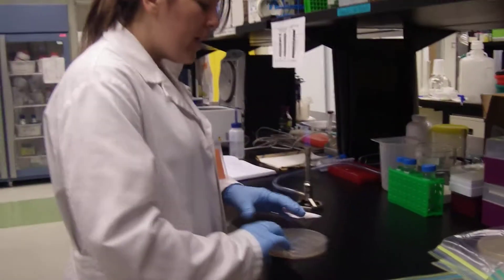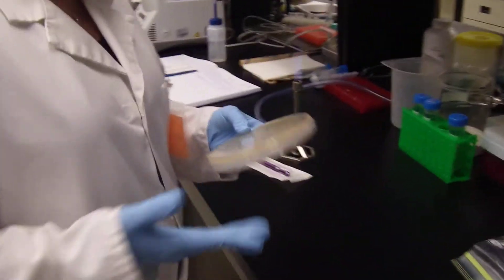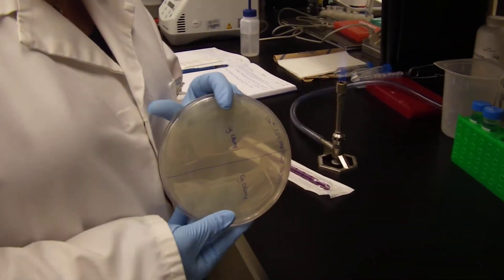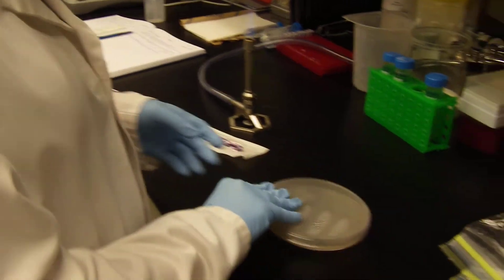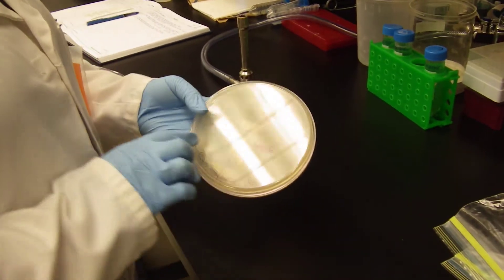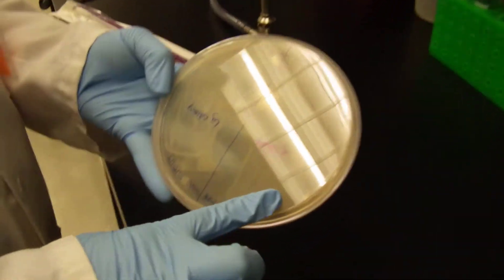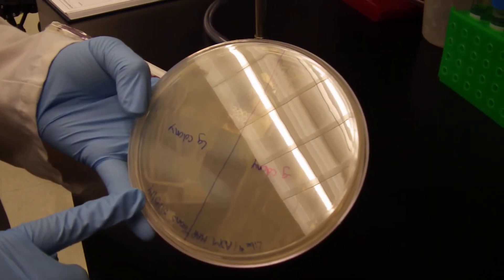Over here I have a plate of MAP that I was growing for various reasons. You can see I've got a lawn of MAP on either side of the plate.